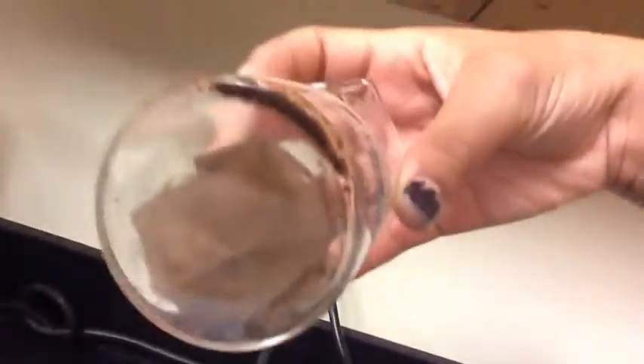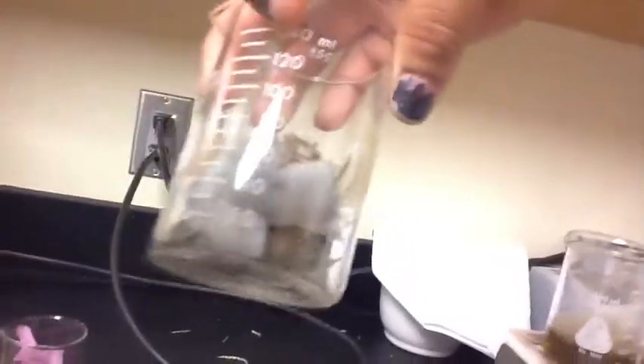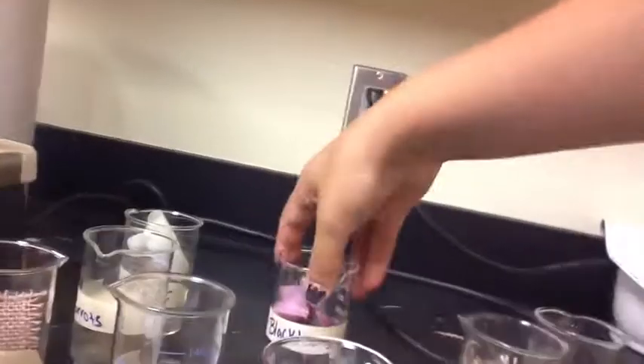The yellow flower still not much of a change. We have our pine cone, which made very subtle brown changes. Tree bark made a mild change. Our strawberry made a very lovely red. Pink flower did nothing. Our red cabbage created a blue. And our blackberries created a purple blue.